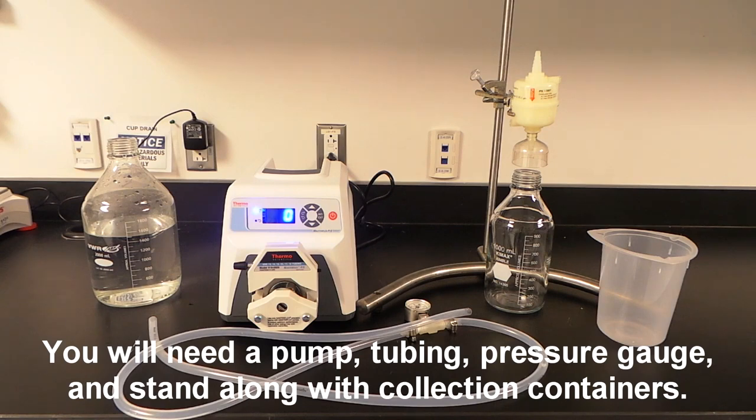You will need a pump, tubing, pressure gauge, and stand to hold the filter, along with collection containers.